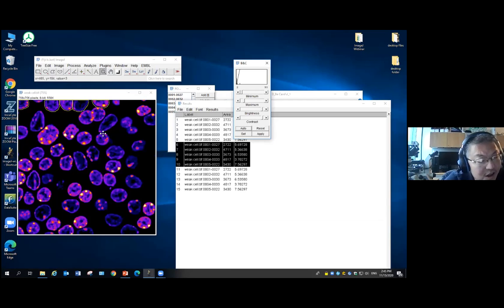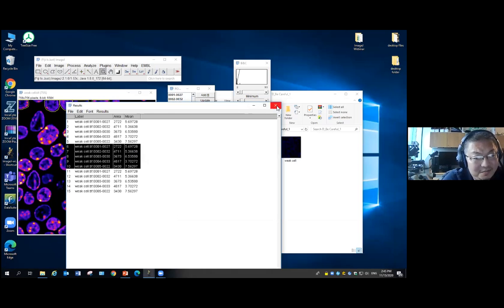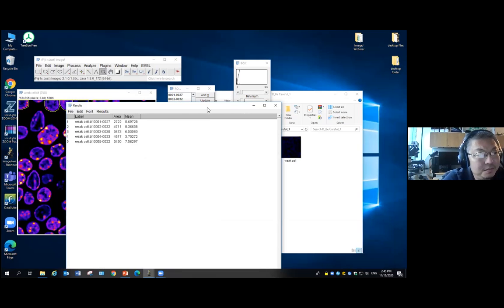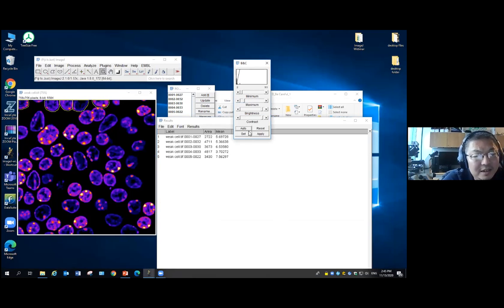It does not change the pixel intensity. It doesn't really change your pixel here when you do the measurement. But let's say I first do a measurement here. There's an apply button here. If you click the apply button, now everything changes. It actually changes the pixel scale based on the settings you choose here.